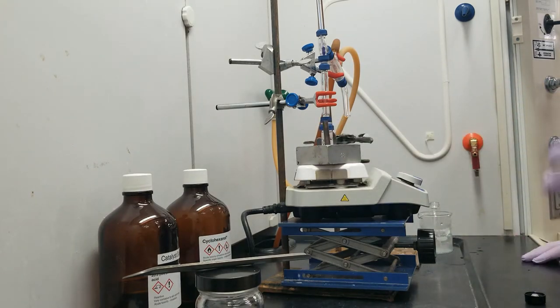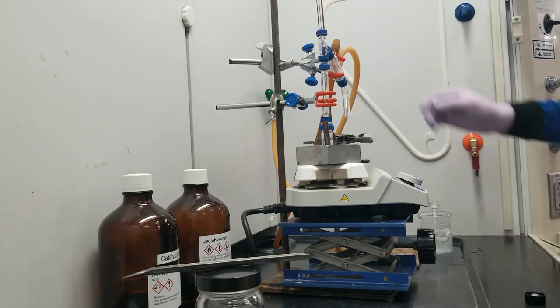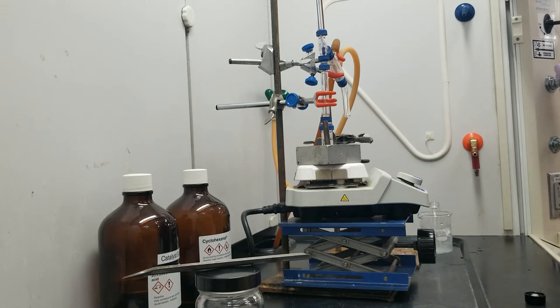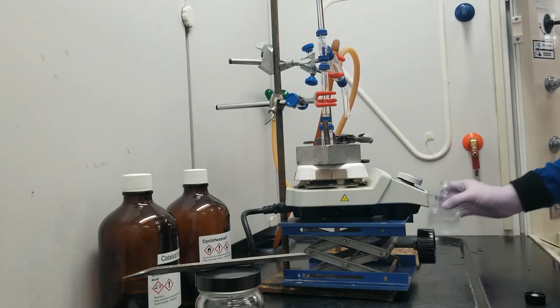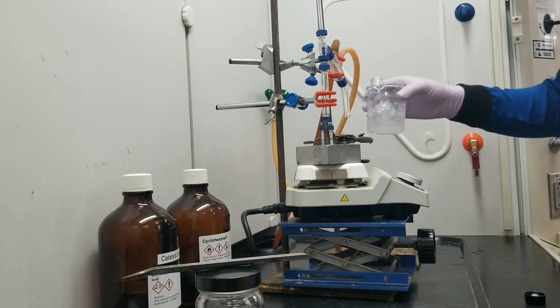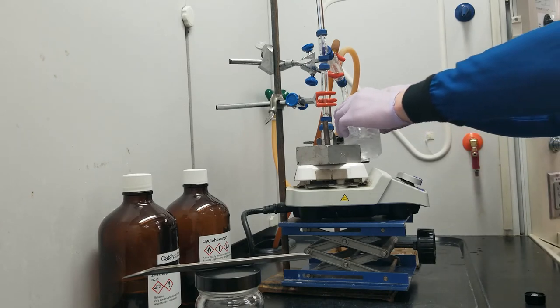Okay, so before I start heating this I'm going to do two things. I'm going to run some water through my water jacket and condenser so that any cyclohexene that we make has to be condensed before it escapes. And then I'm going to set up my collection flask here in a small ice bath.